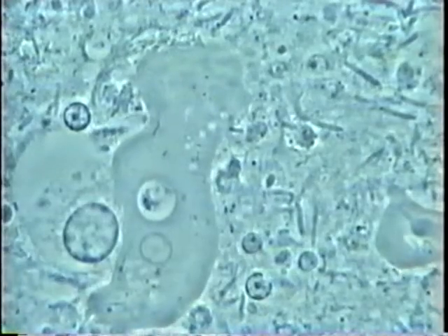We now see many amoeba present that are feeding — this one has just finished feeding on the nucleus of a white cell. It's moving around in the mix of pus, white cells, and motile bacteria. This is very active, and this is where you might lose some bone around your teeth.